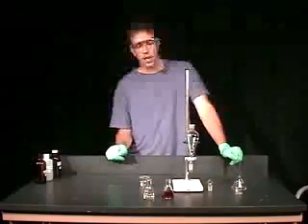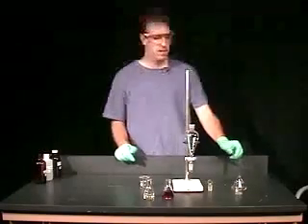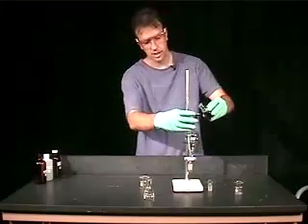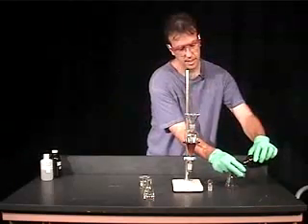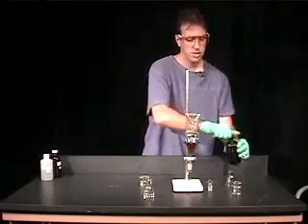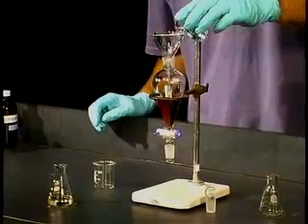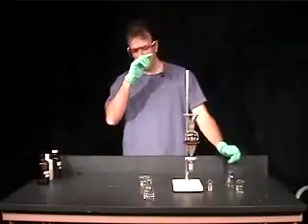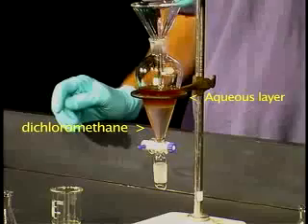I'm going to repeat this procedure using dichloromethane as our solvent. I'm going to simply pour the tea solution back into our separatory funnel. Now, dichloromethane has a density which is larger than water, so you're going to see a bit of a difference in this extraction. As you can see, the dichloromethane is more dense, and it simply goes straight to the bottom of the separatory funnel.